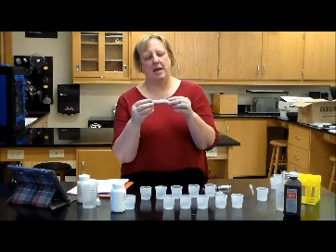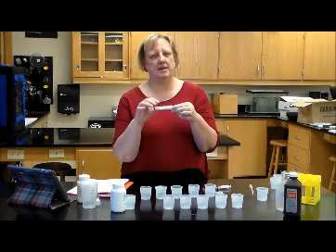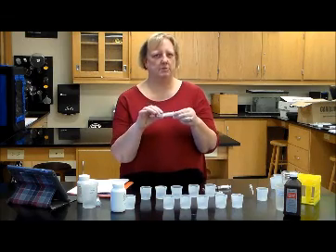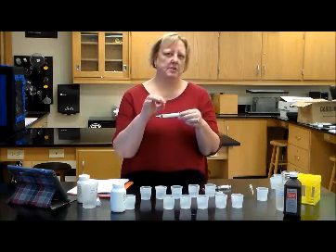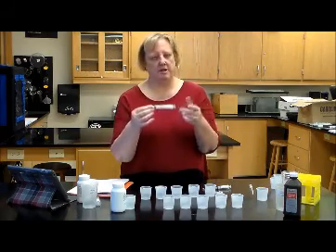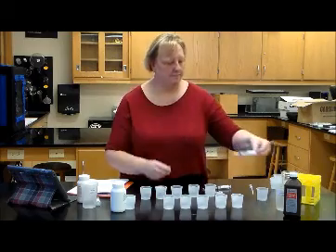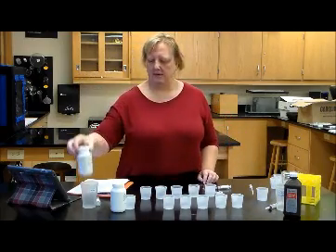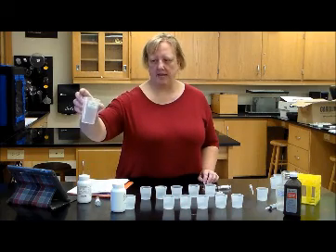For this particular lab, it's very important that you read the labels two or three times before you actually use them to make sure that you're using the right syringe for the right component. Because if you don't, you ruin the lab and have to start over. Another component that you'll use is sulfuric acid. You'll have a container full of sulfuric acid here.